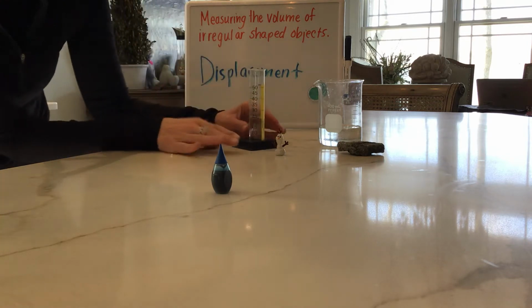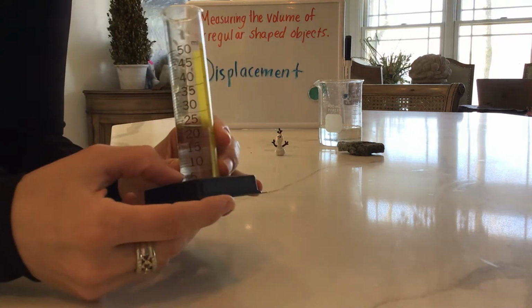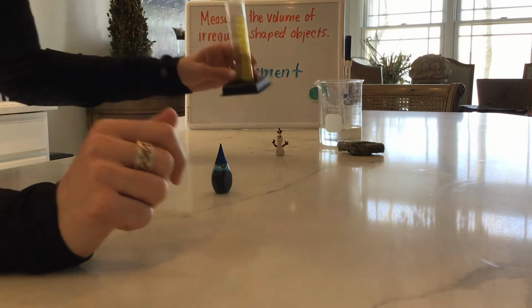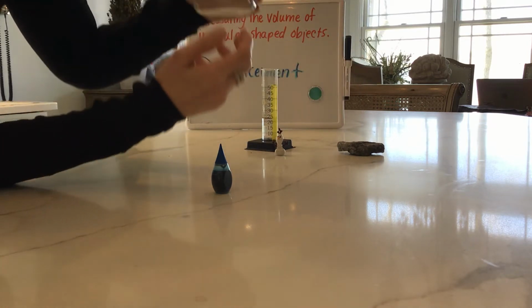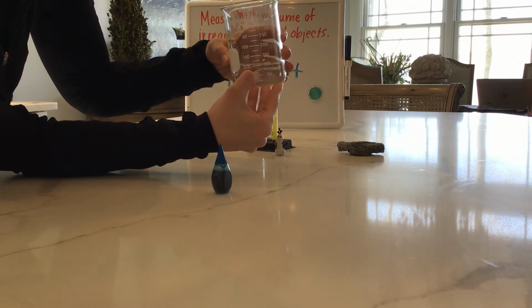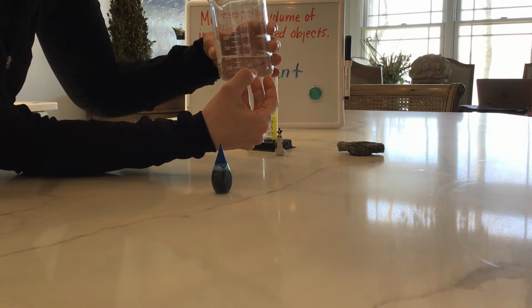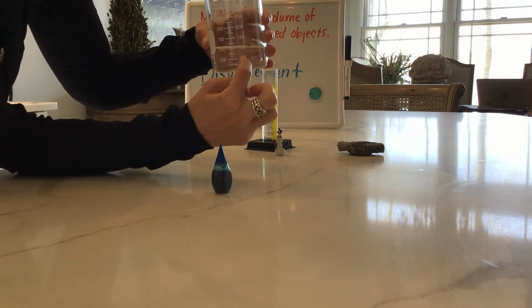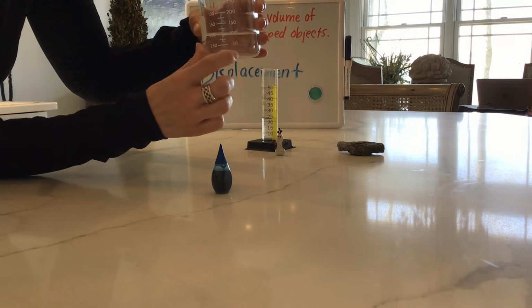I have my graduated cylinder here, and this one has graduations of fives, right? So it goes up 5, 10, 15, 20, 25, 30, 35, 40. And the beaker goes up by 25s. So here you can see that it goes up by 25, 50, and then it doesn't actually say 25, but I know that the first marking is 50, and then there's one in the middle that doesn't have a number, and then there's 100.